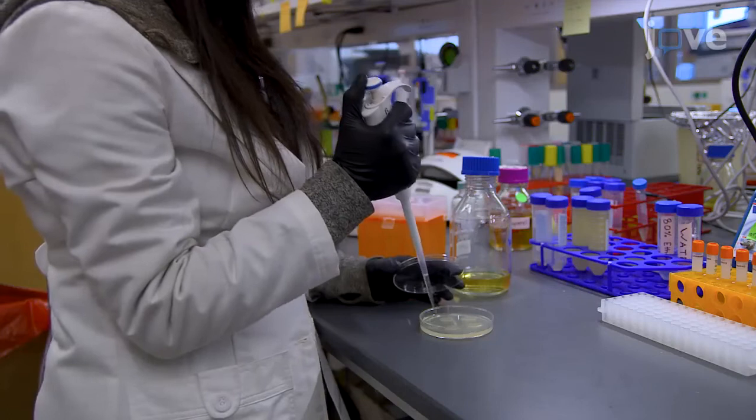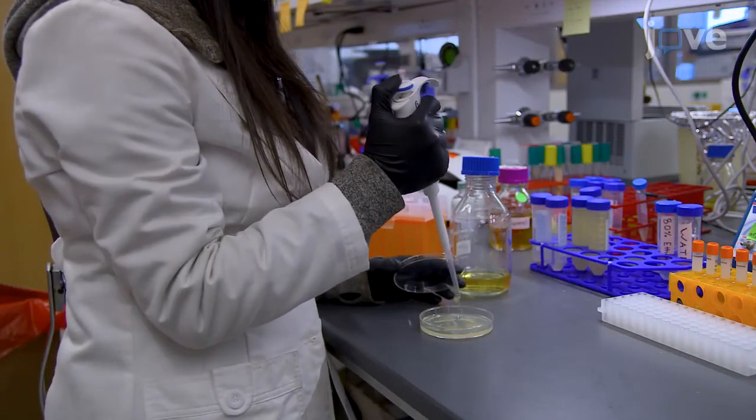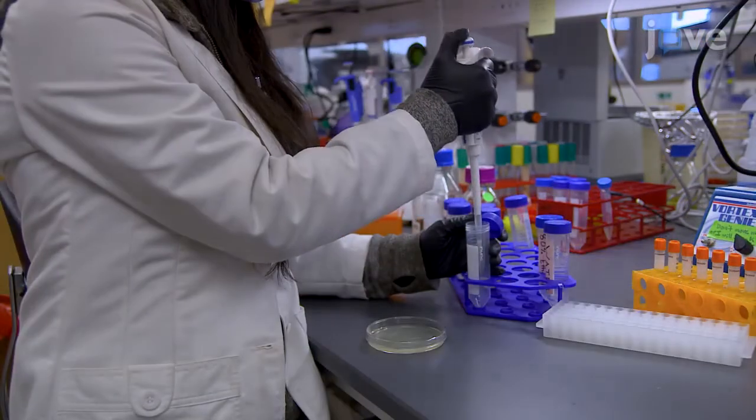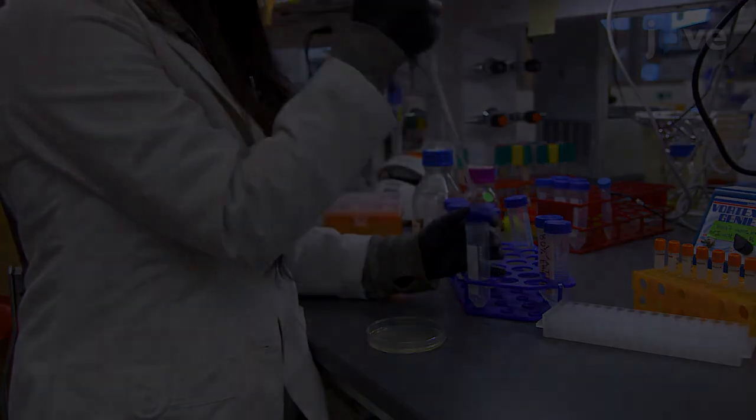After the incubation, add 1.5 mL of LB onto each plate and harvest the bacteria into a 50 mL conical tube.